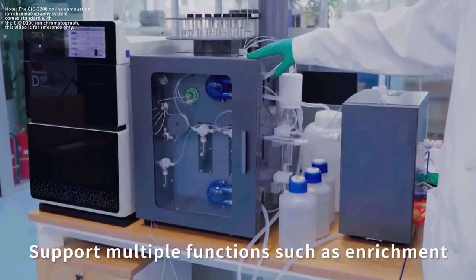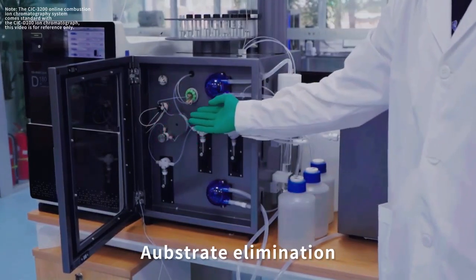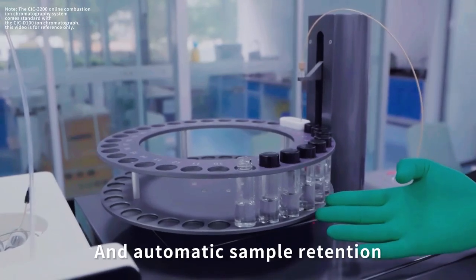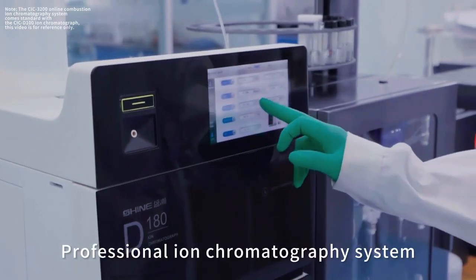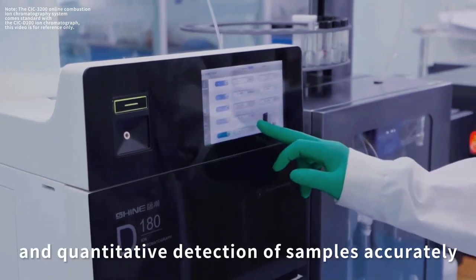Absorption unit: support multiple functions such as enrichment, substrate elimination, automatic configuration of absorption solution, and automatic sample retention. Ion chromatography: professional ion chromatography system, which can achieve qualitative and quantitative detection of samples accurately.